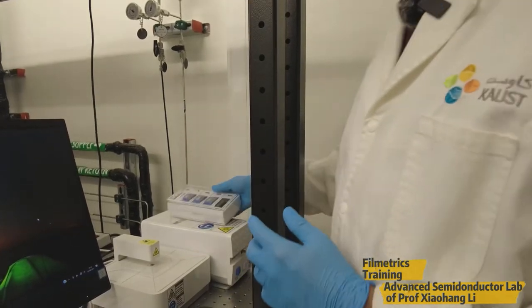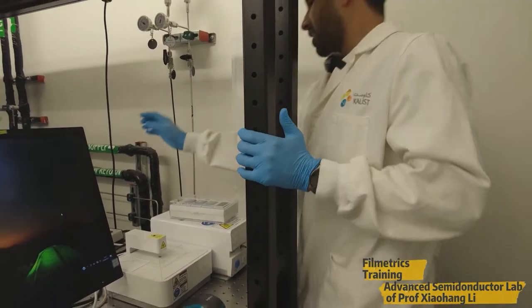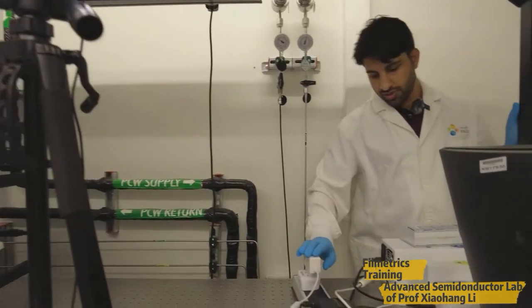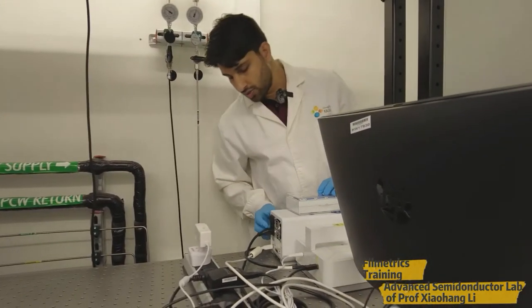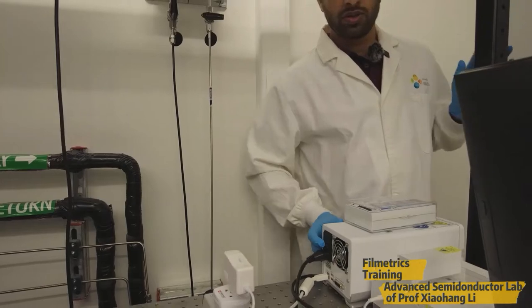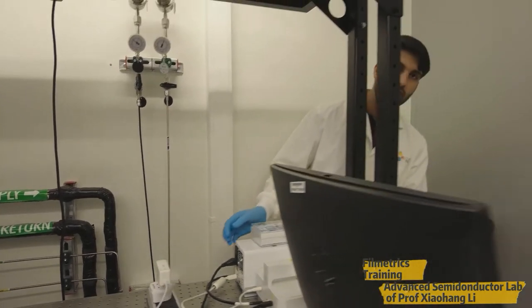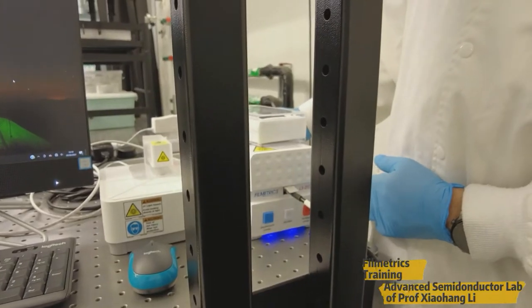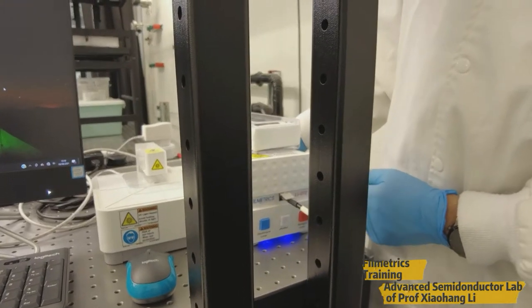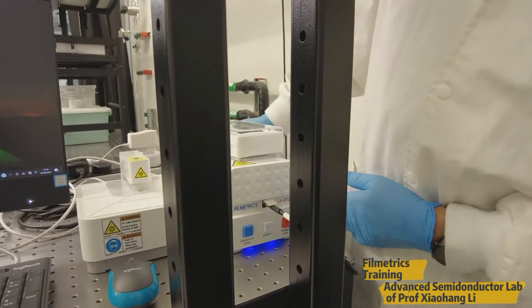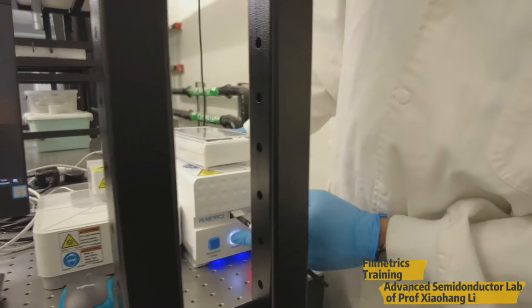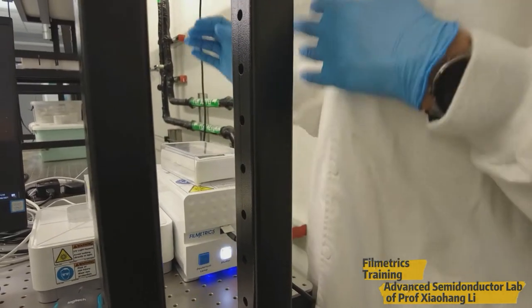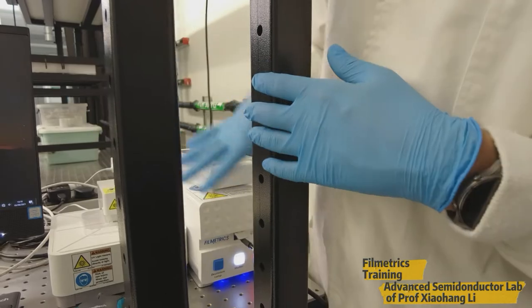So first of all, what we have to do? We have to connect this power supply for the source. It is connected here. So we need to turn it on. So after turning it on, on the front side, we have different switches. There are different switches on the front panel. These are for the lamps as well as for the shutter. This is for halogen lamp. This is shutter. This is deuterium lamp. So please wait for some time for stabilizing the lamp.